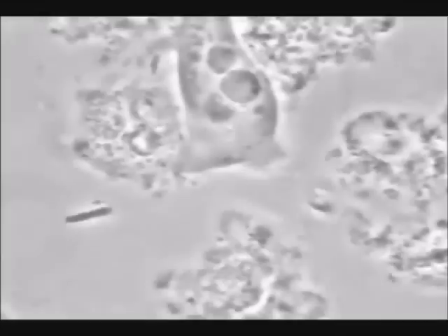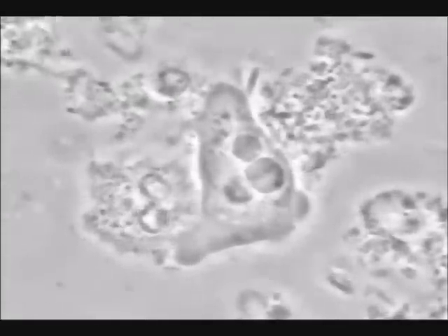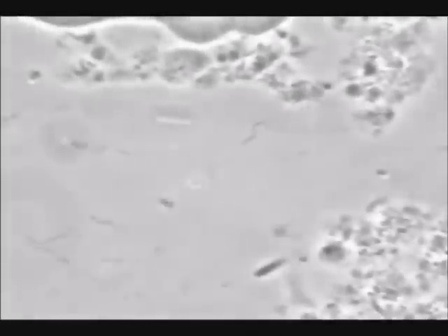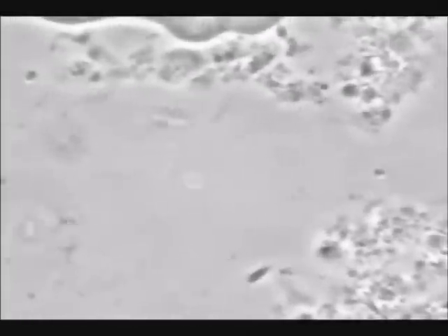Here we have a case of generalized aggressive periodontal disease. We see the biofilm with some bacteria, some white cells, and in the center Entamoeba gingivalis, which is usual in this disease. Here is a granulocyte, and here we have the amoeba.